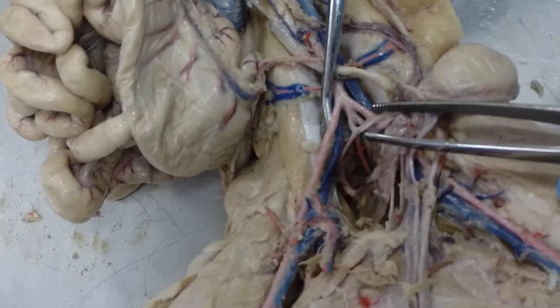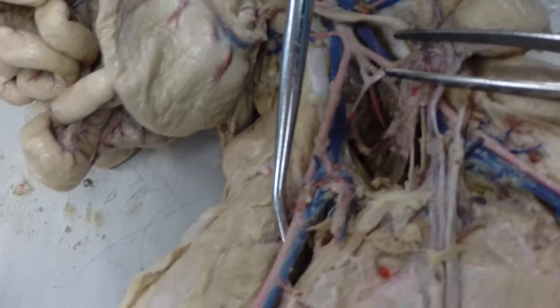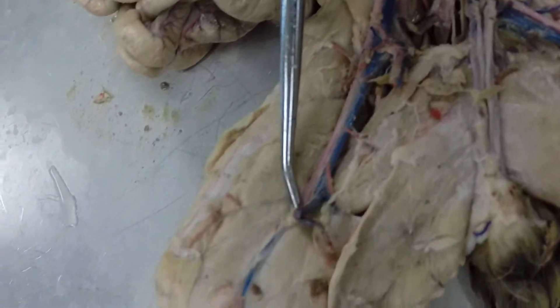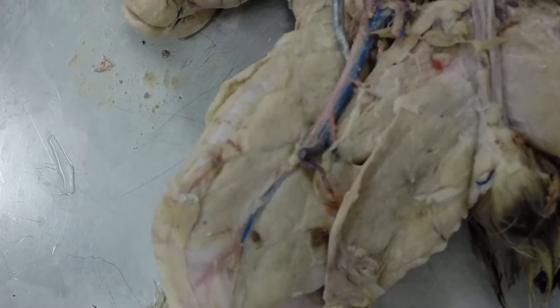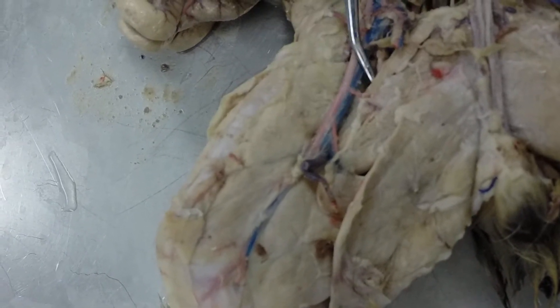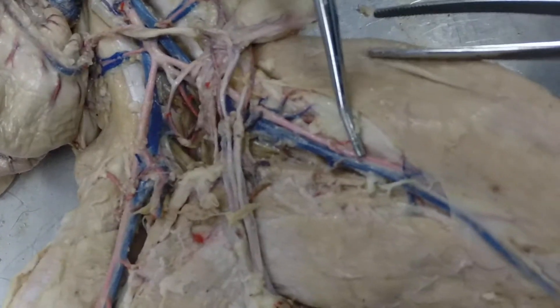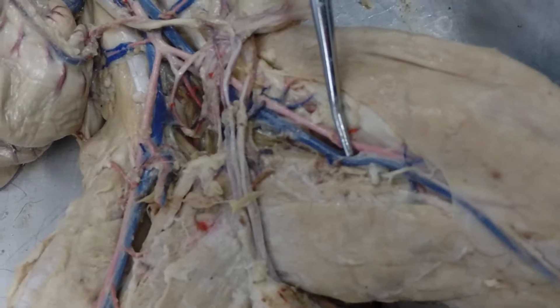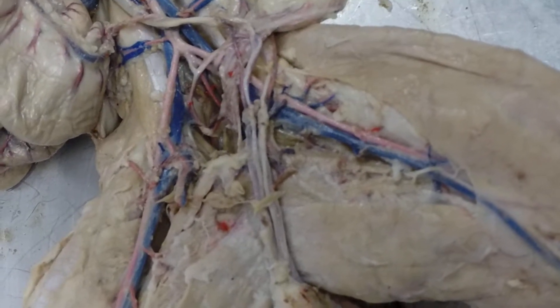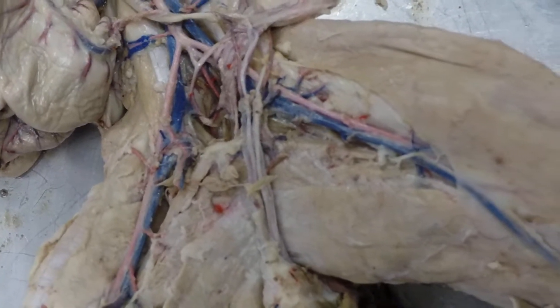The external iliac artery is going to continue out across the leg, at which point we call it the femoral artery — this would be a right femoral artery, and this would be a left femoral artery. Okay, that's it for the arteries. Let's look at the veins next.